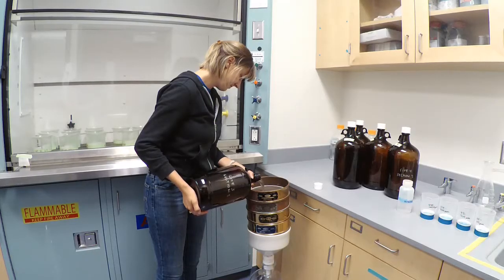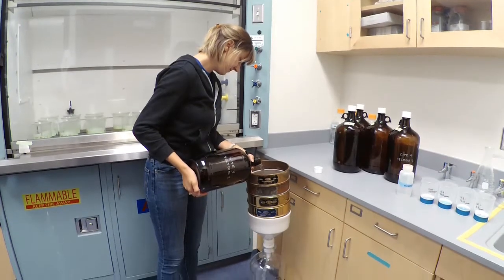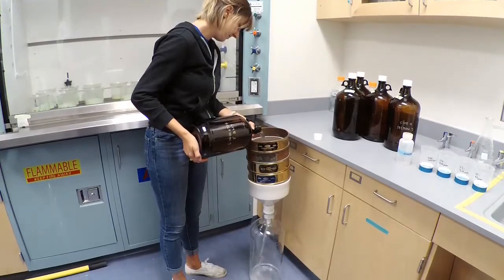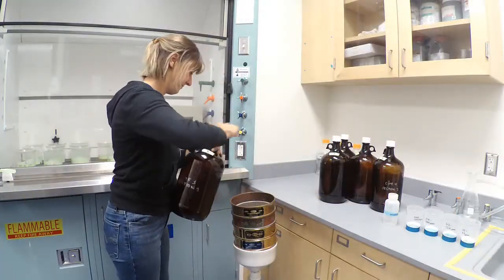The first step of the protocol starts with pouring all 20 liters of water through the stainless steel sieve stack. Rinse each bottle three times with Nanopure water.